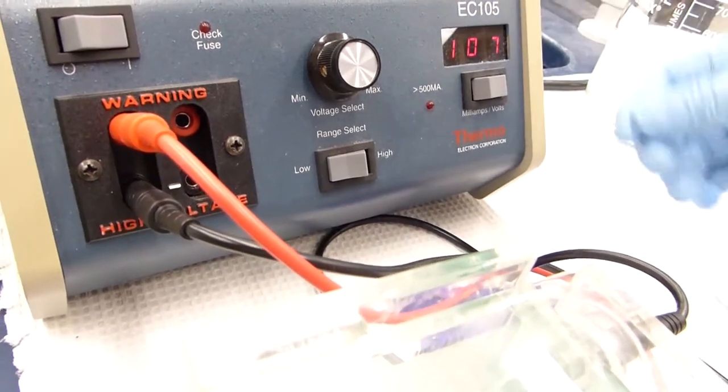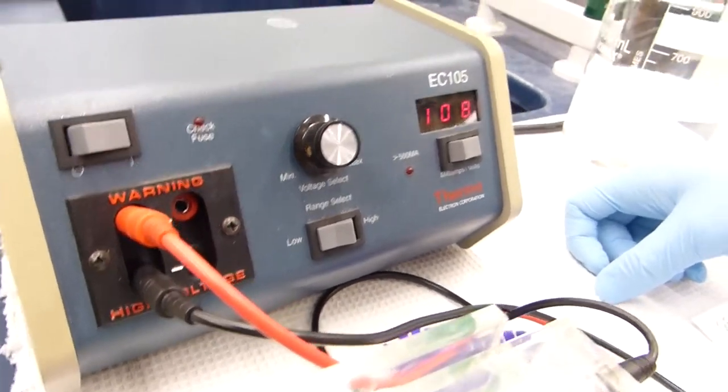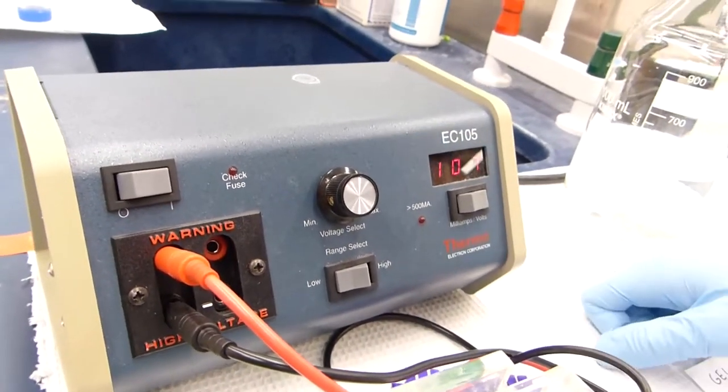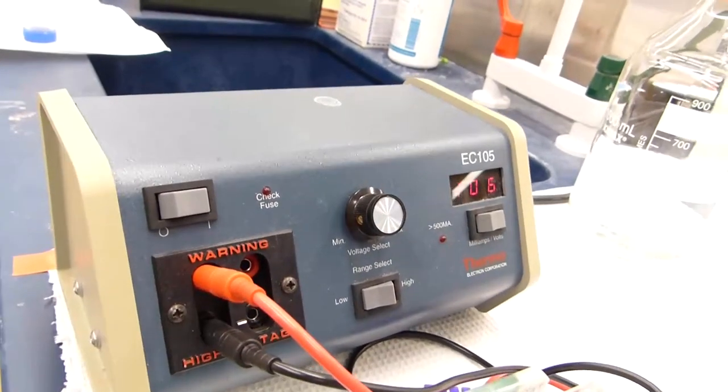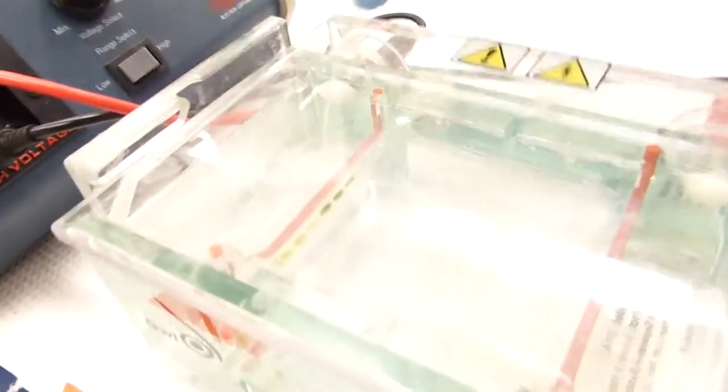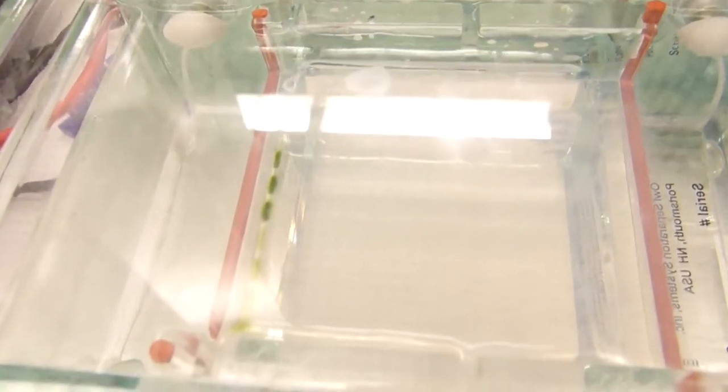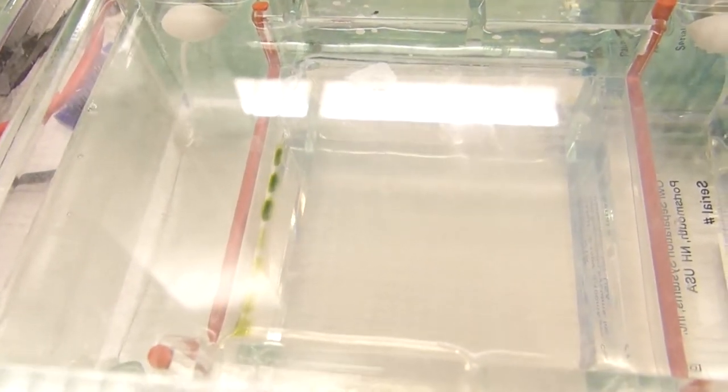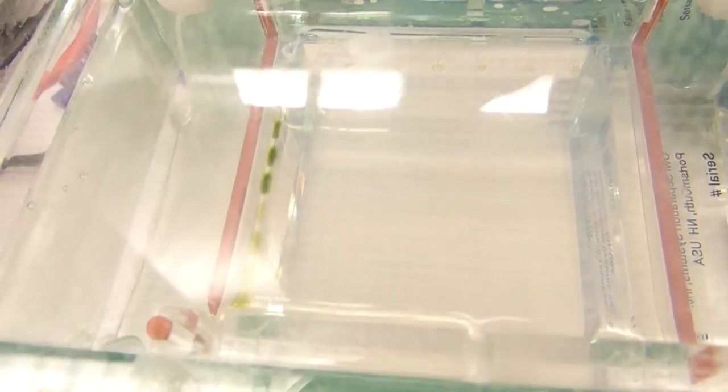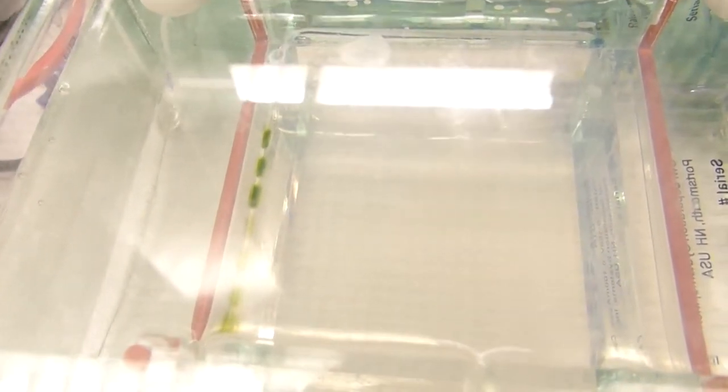This is set to a little over 100, that is good for having it done in 10-15 minutes, sometimes a little less. You want to make sure to watch your gel dots as you will see the colors spread while the gel is running. So check it every few minutes, make sure that the gel does not run off the end or if you have two layers that the gel does not run into the next layer.